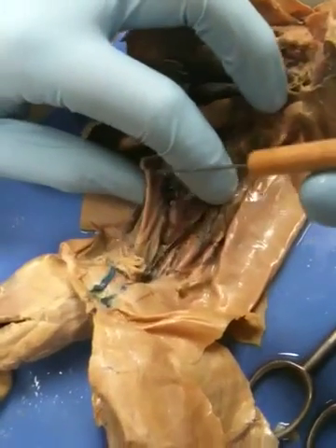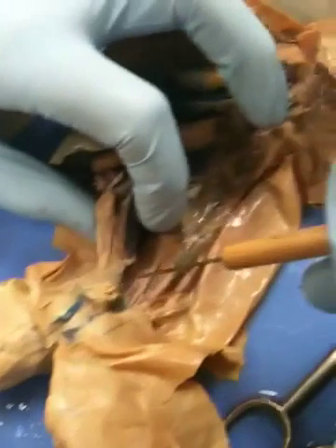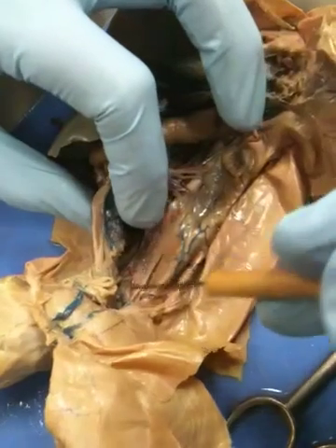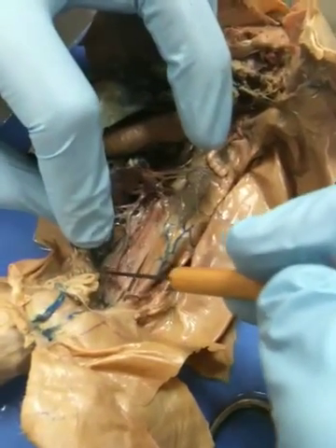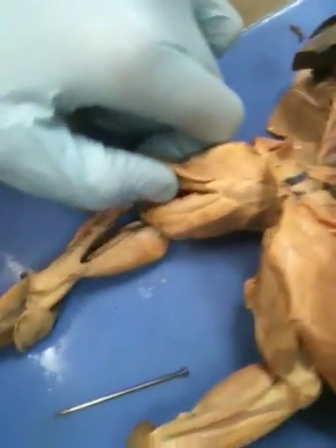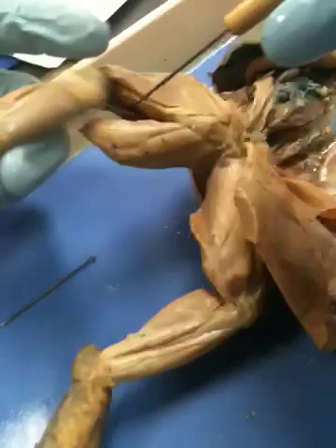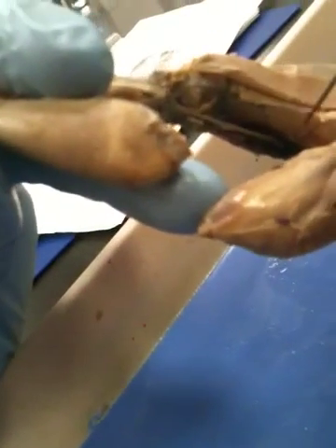Now, inside the legs, somewhere around here, you're going to have the common, here we go. These are the common iliac arteries right here. These run down to the legs. Down here somewhere, it's going to run and goes to this side. And from here we have the femoral artery. The femoral artery is pretty easy. It runs by the femur.